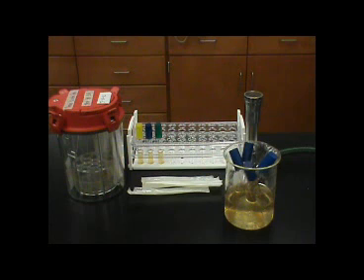The aerotolerance test is important for understanding the oxygenic requirements of different bacteria. This allows an understanding of the different growth requirements and ecological niches that some bacteria occupy.